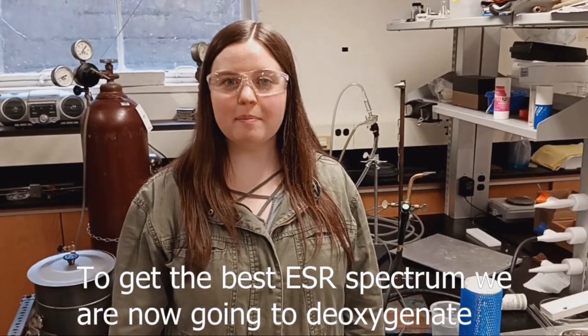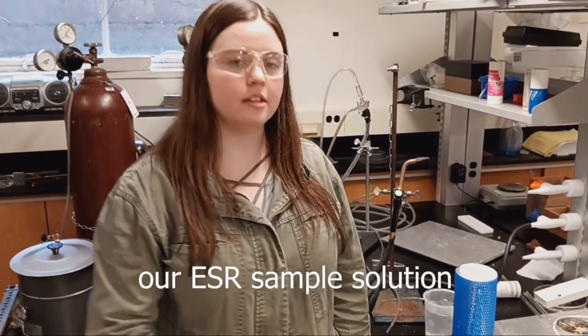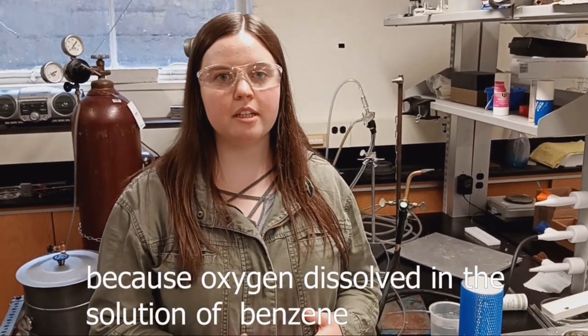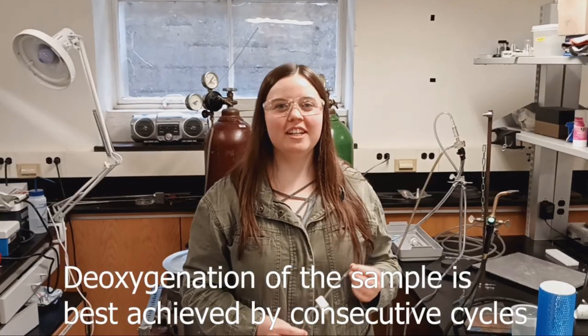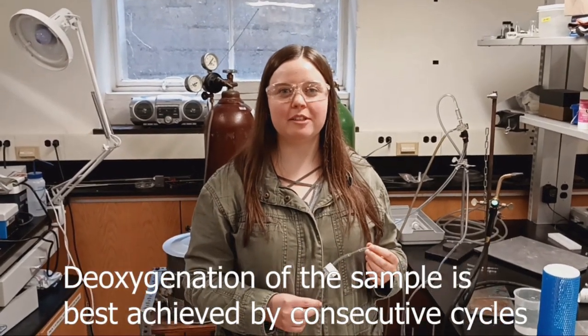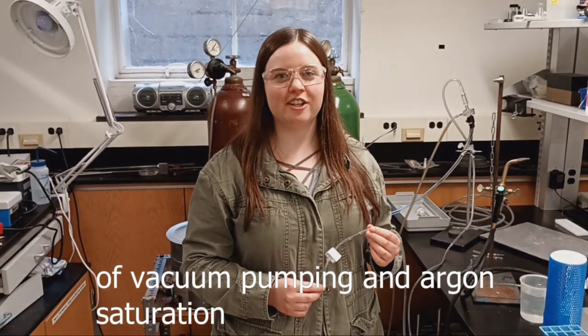To get the best ESR spectrum, we are now going to deoxygenate our ESR sample solution, because oxygen dissolved in the solution of benzene is going to broaden and weaken ESR lines. Deoxygenation of the sample is best achieved by consecutive cycles of vacuum pumping and argon saturation.